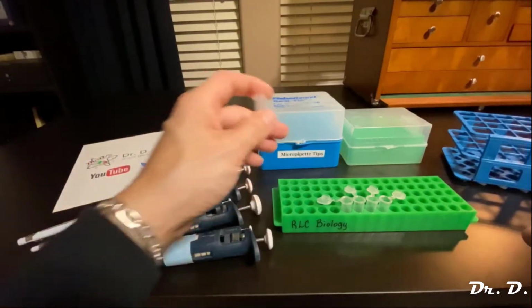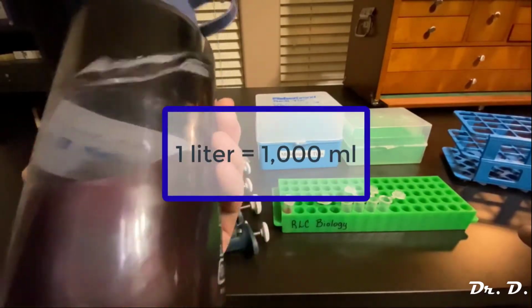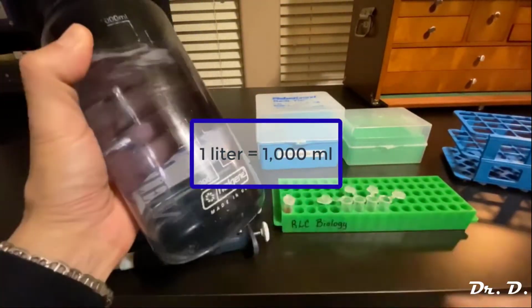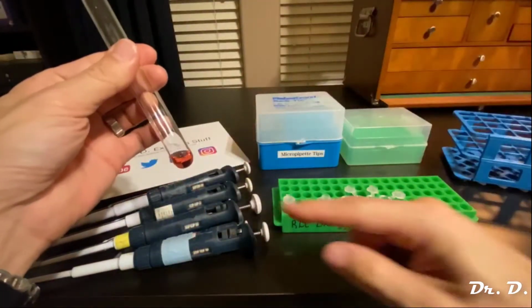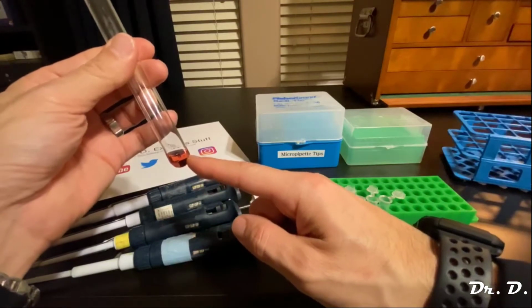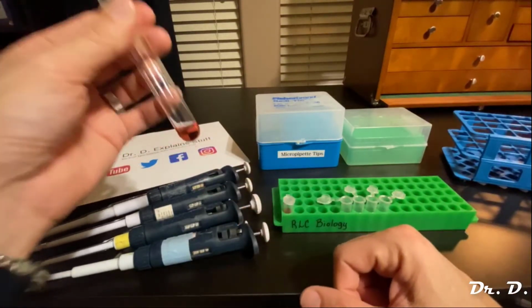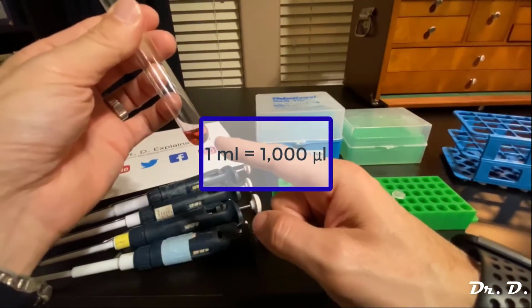And if you remember, this is a liter, and a liter has 1,000 milliliters in it. 1,000 milliliters in a liter. Okay, and what's a milliliter? This much. This is 1,000th of a liter. Well, guess what? A microliter is 1,000 times smaller than that.